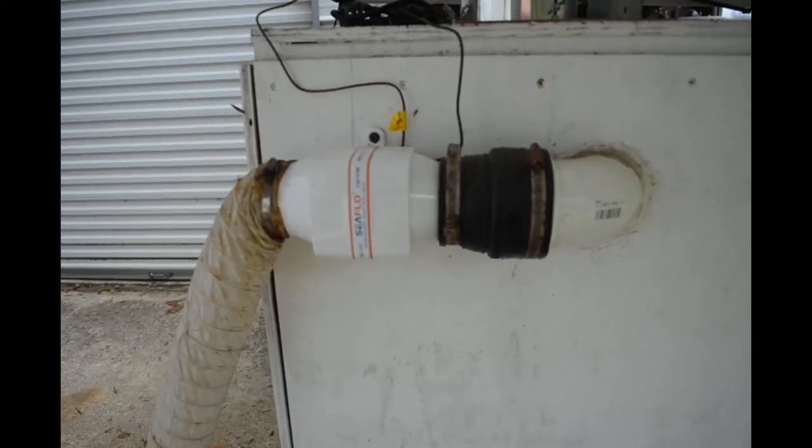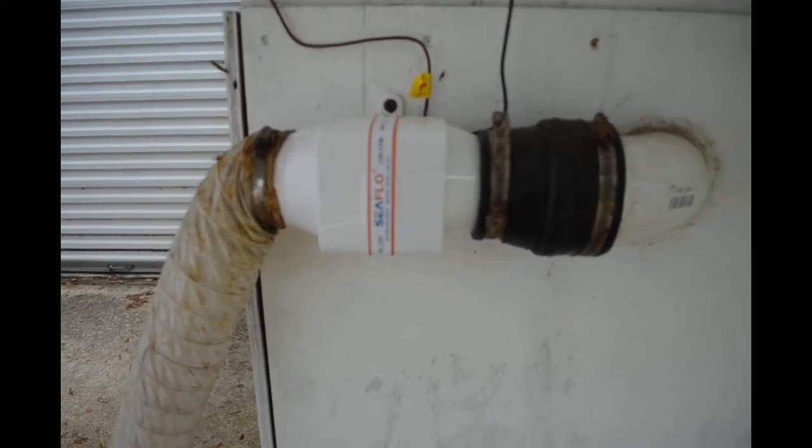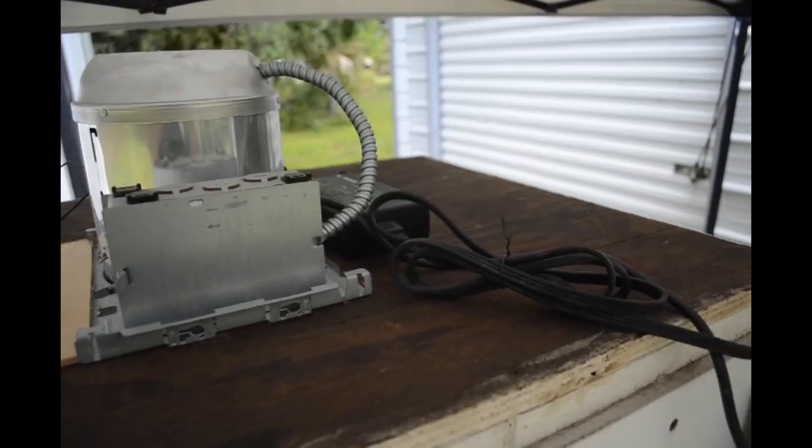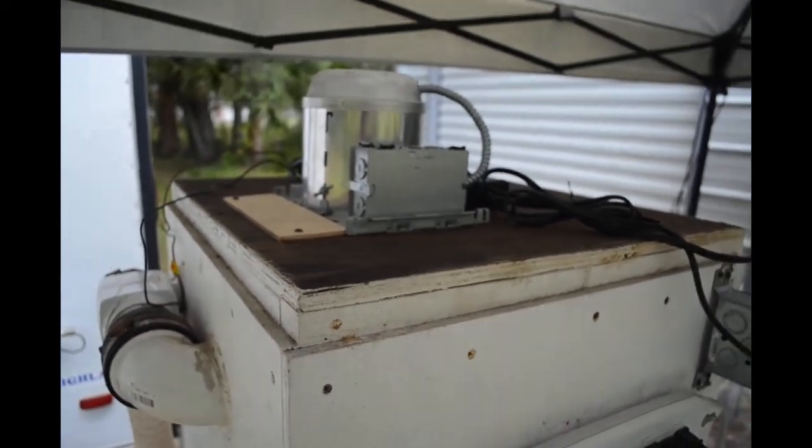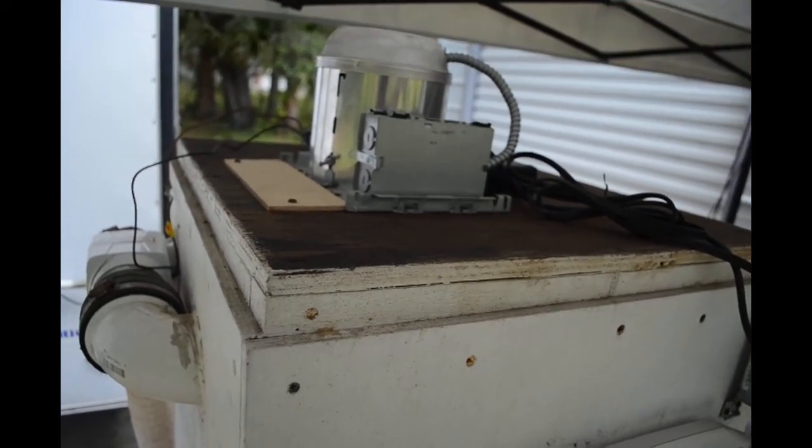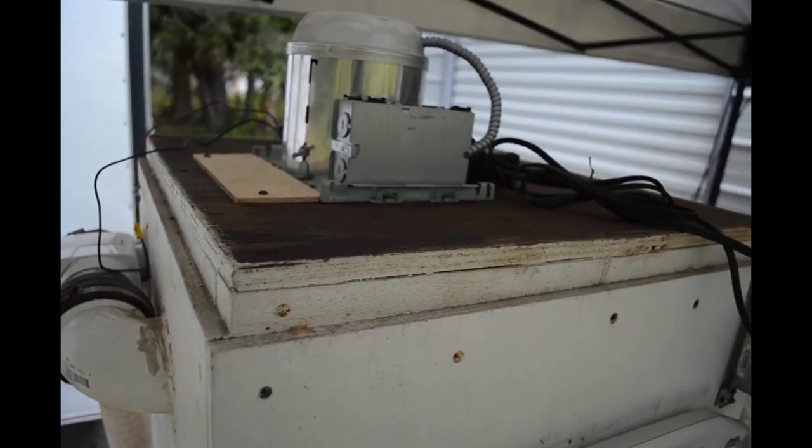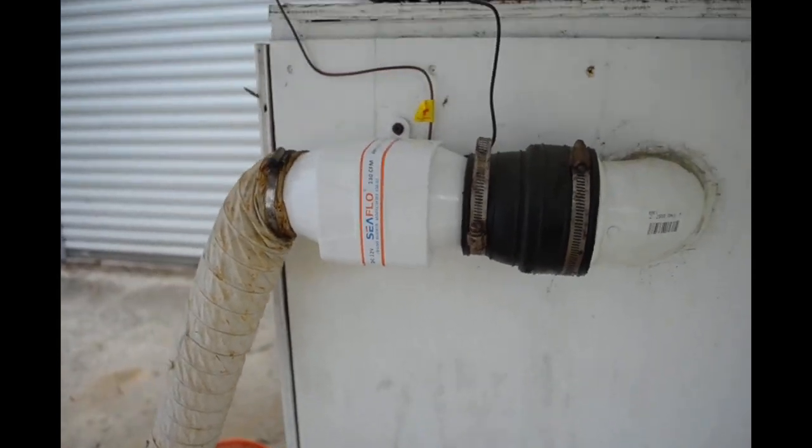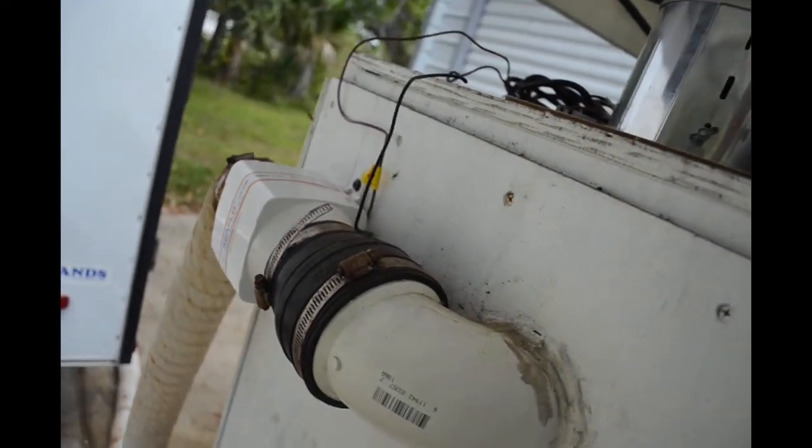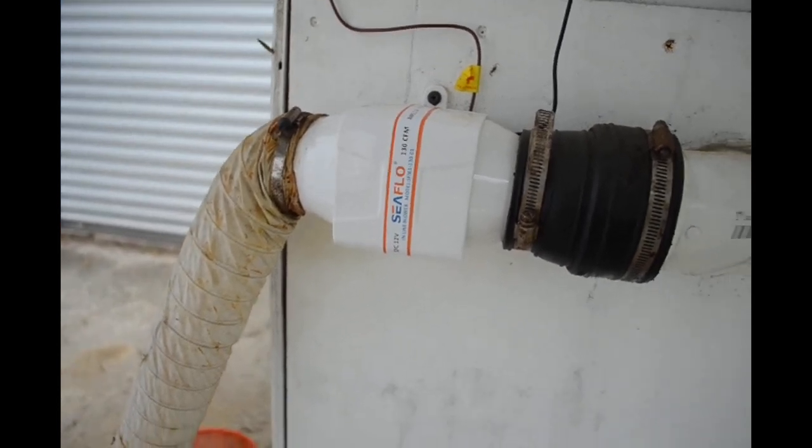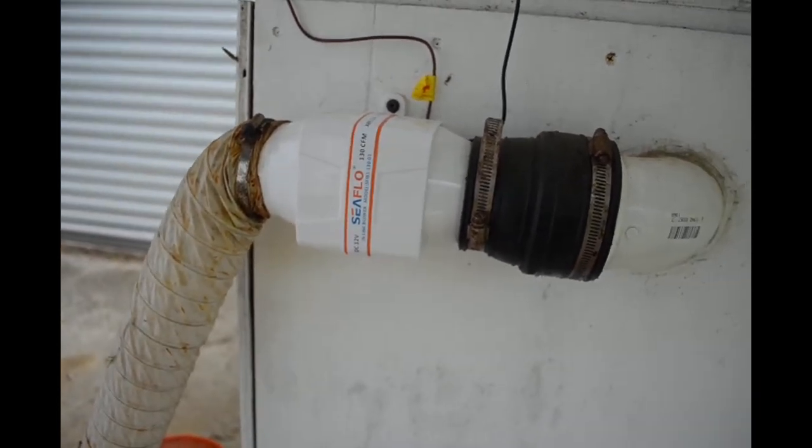Here's the blower I'm using - it's a bilge blower from a boat, 12 volts. I've got a power supply from an old laptop up here that's powering it. I'm thinking about just boxing in this whole area up on top here to protect everything from the weather and run the wiring a little neater. Let me turn it on - not too loud right now because it's fairly new.